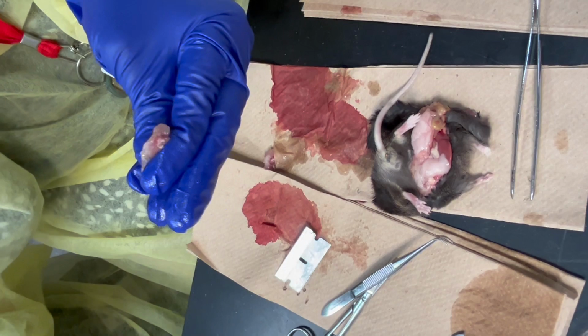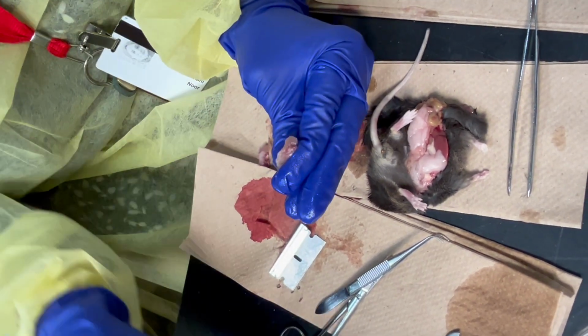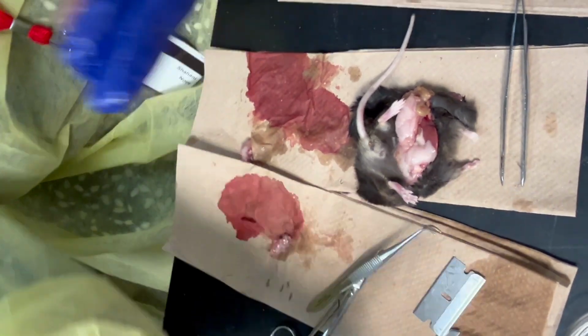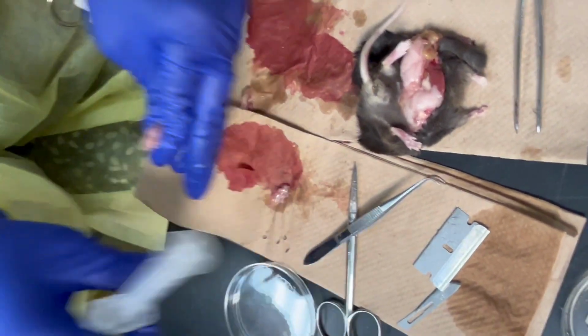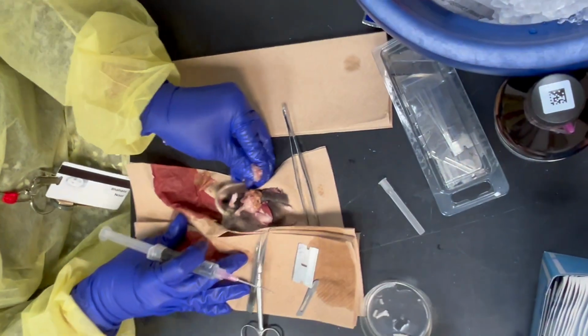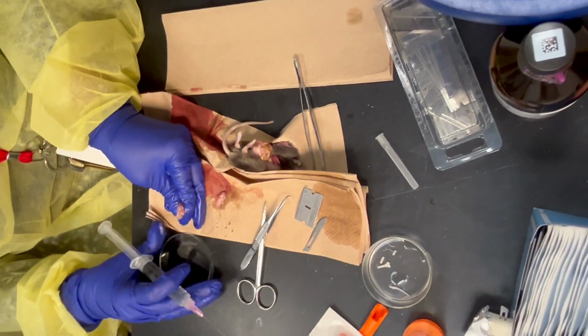And the other thing is, of course, speed. Because like I said, when things are cold, the tissue is more stiff. And as time goes by, it just becomes more and more of the issue we were having the last time.